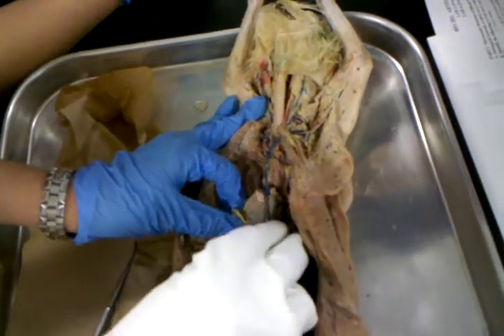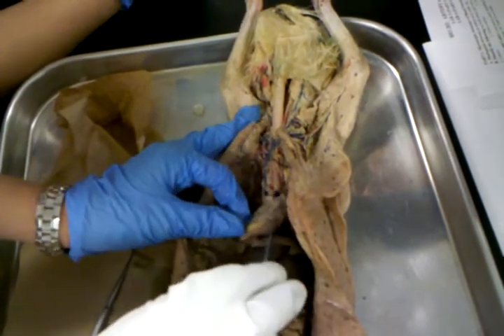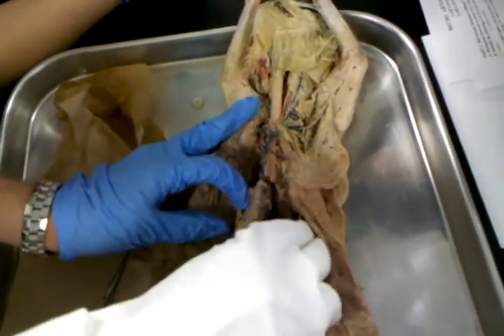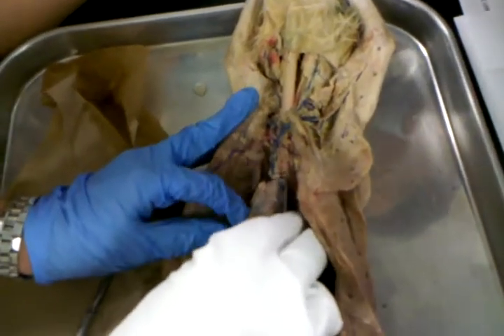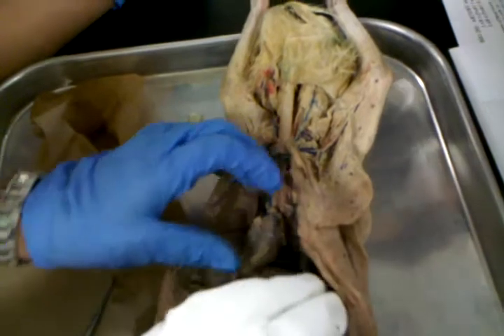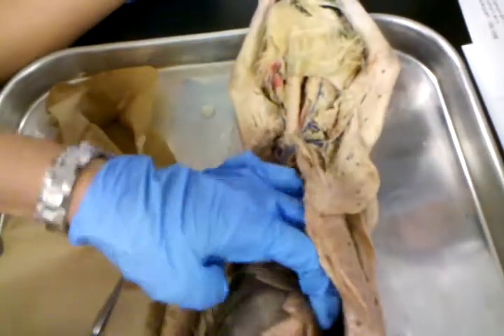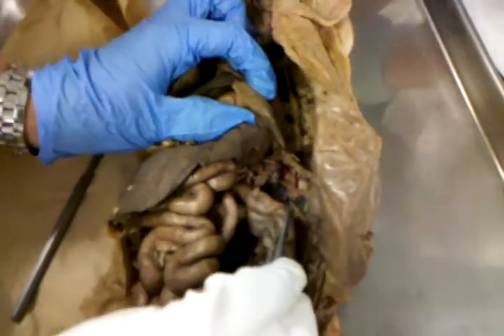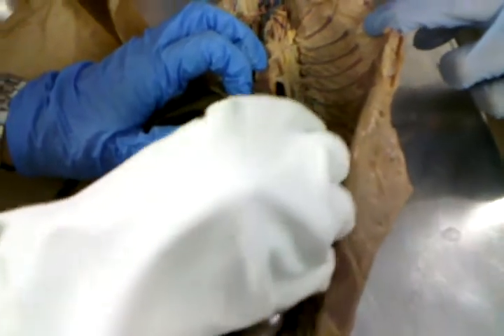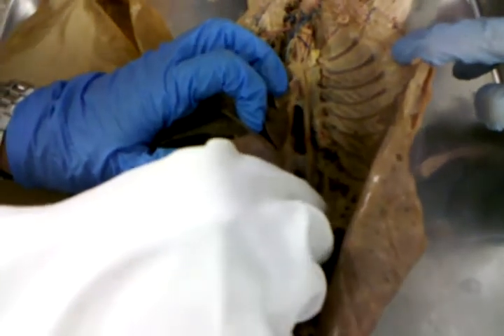This is the heart. Here's an atrium. Here's the other atrium of the heart. Okay. And coming out of the heart, you have the aorta right here. See that they chopped the base of the aorta right there, but the aorta loops around and it continues on down into the abdominal cavity. See that? Branching off of the aorta, you see these little things going between the ribs that are red?